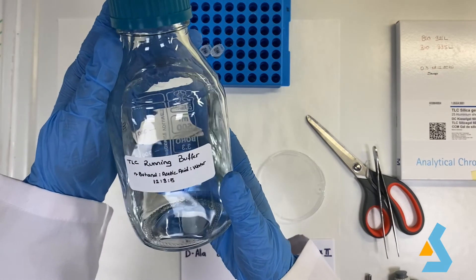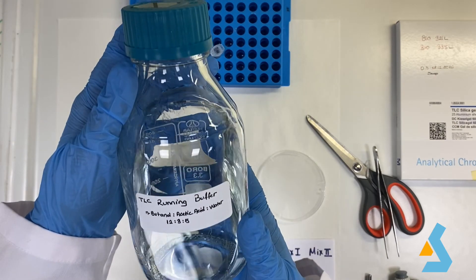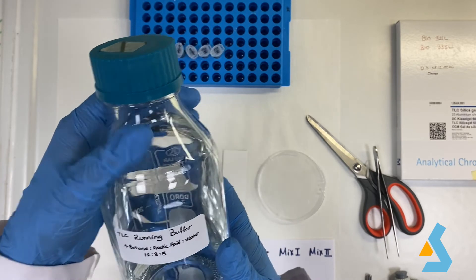Next, we have the solvent, the TLC running buffer. This buffer has n-butanol, acetic acid, and water with 12 to 3 to 5 ratio respectively.